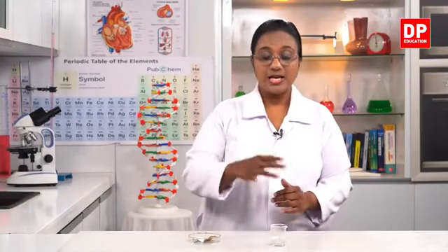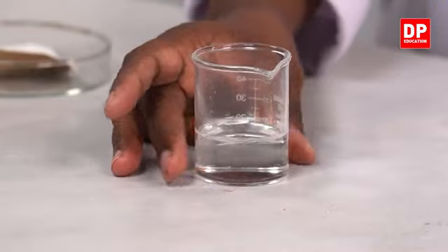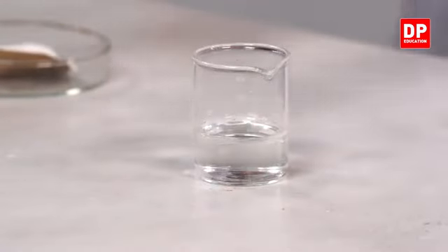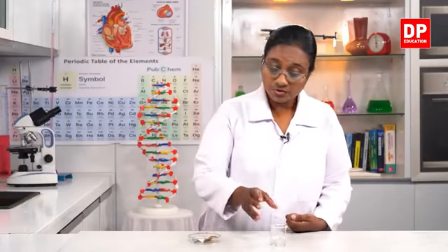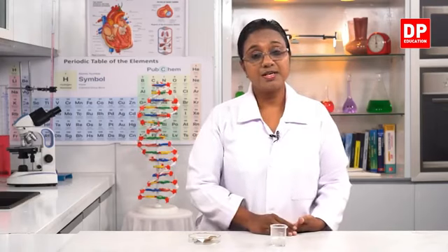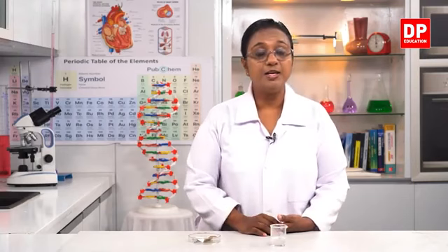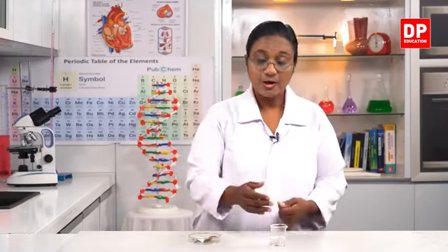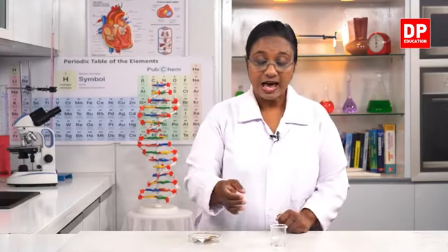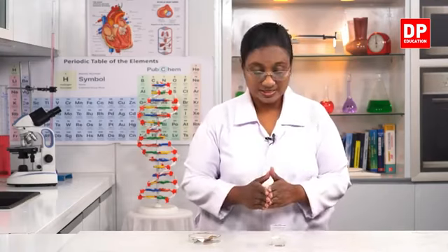With that, students, now you all can't see that if I touch the beaker like this, I can feel it becoming warmer. So, like in the previous activity, we use the thermometer to observe the increase in temperature. Here also, if you need, you can measure the temperature, but if you just touch the beaker itself, you can feel it becoming warmer. So, there are two changes that can be observed clearly. One is the liberation of gas and the other one is the beaker becoming warmer. So, two changes.